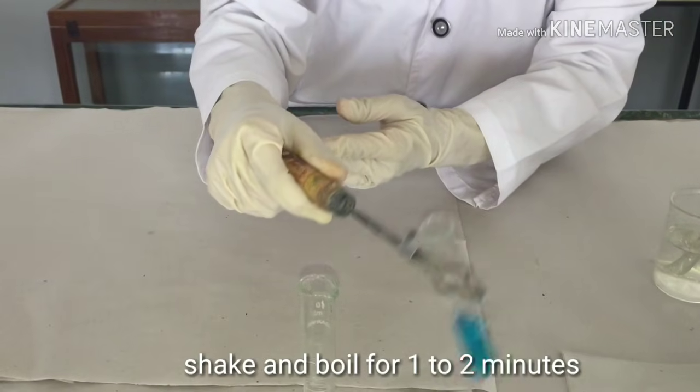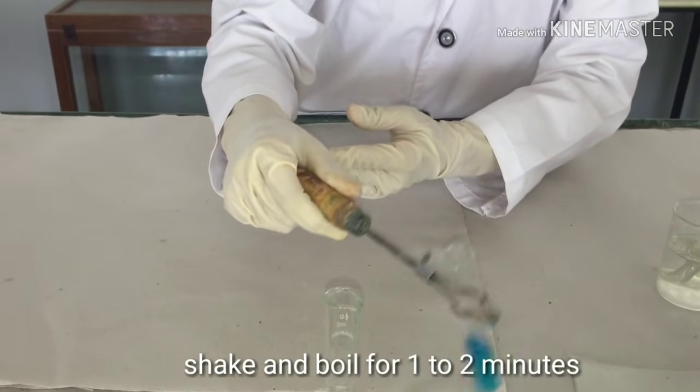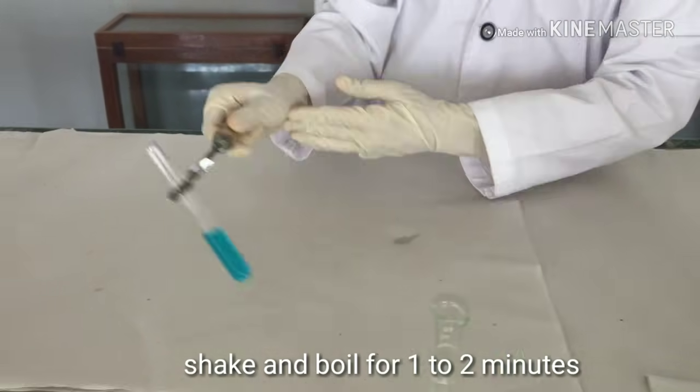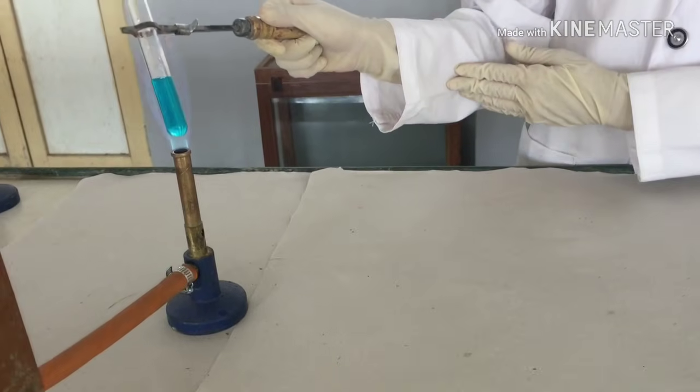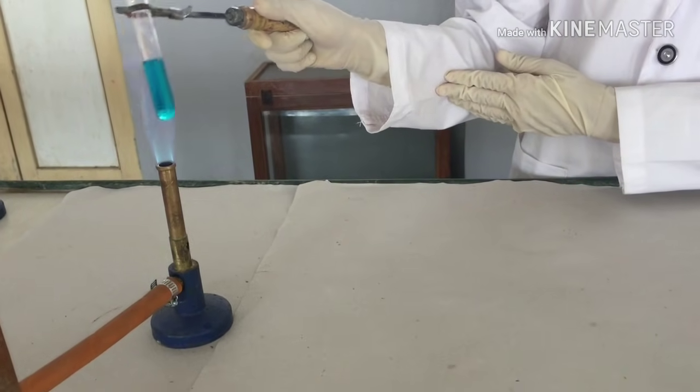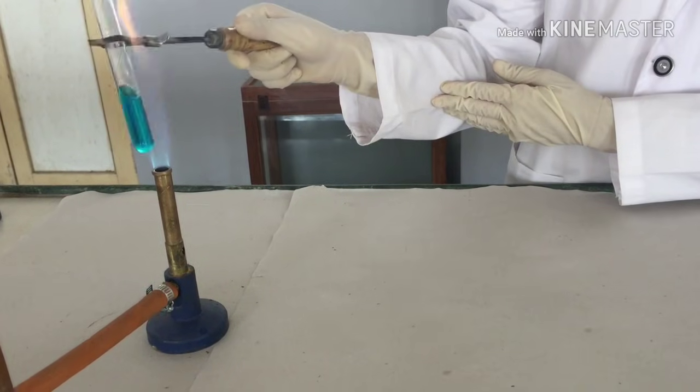Shake the contents well and boil it for approximately 1 minute. Shake the test tube while heating it.